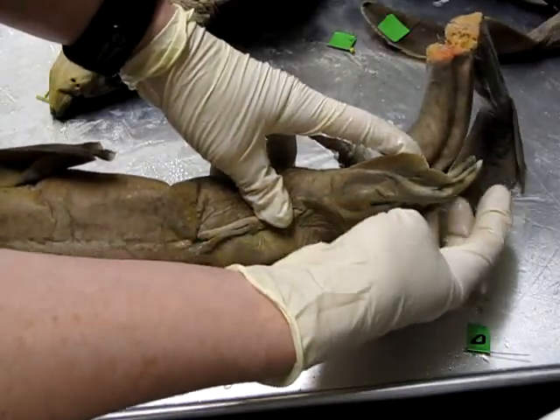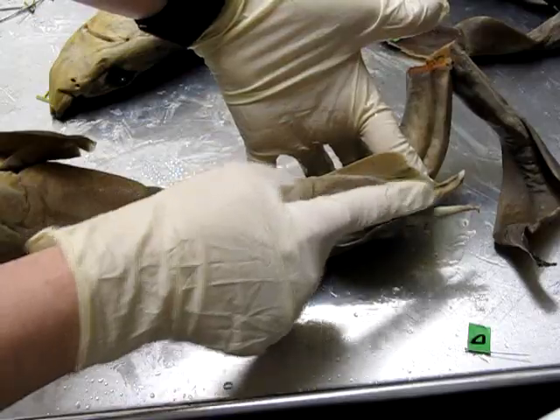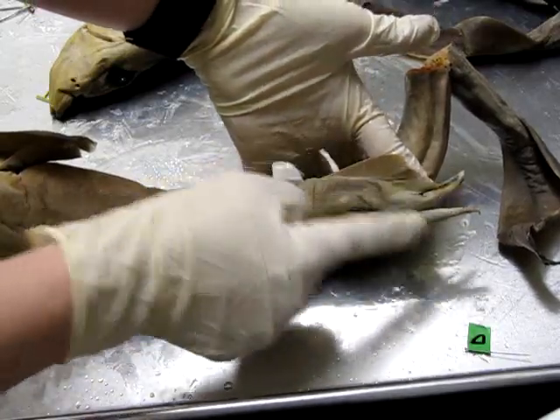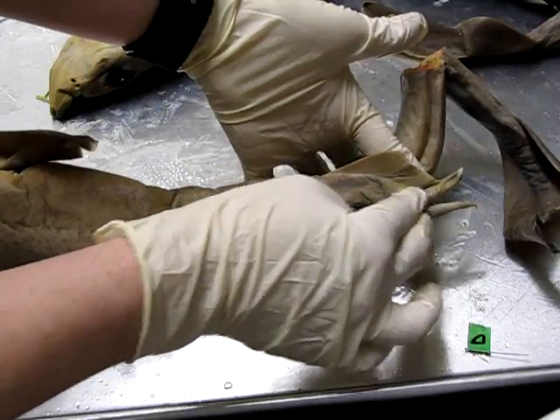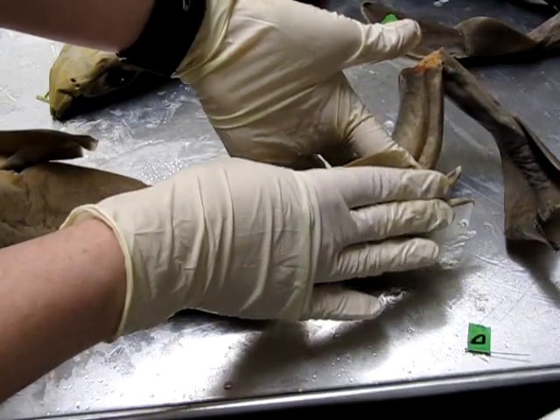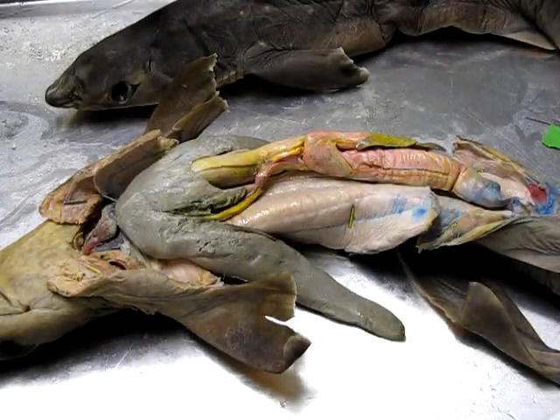If we look at the side here in the pelvis region we have a pelvic fin — in fact there are two. This animal is a male, so you can see how the pelvic fin has been modified to have these rigid structures called claspers. Those would only be found in males and are involved in active copulation.